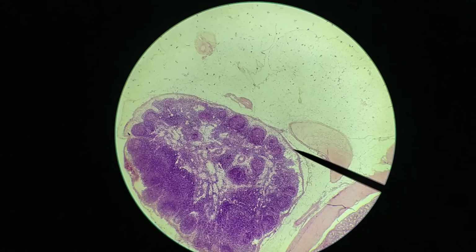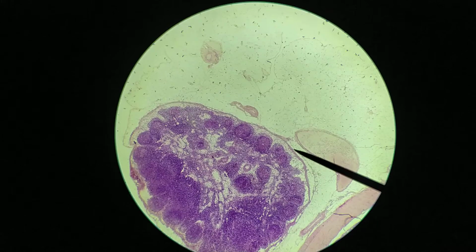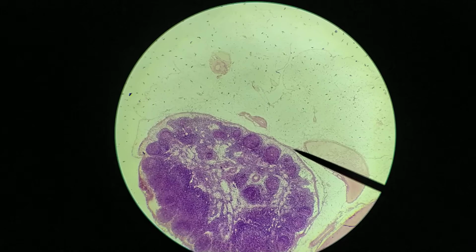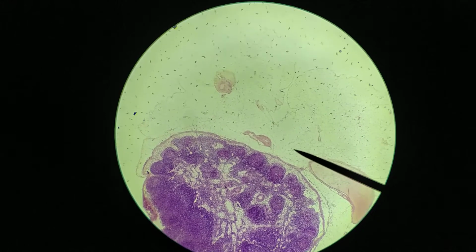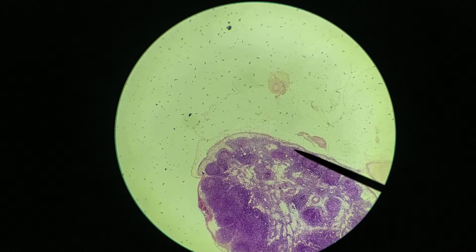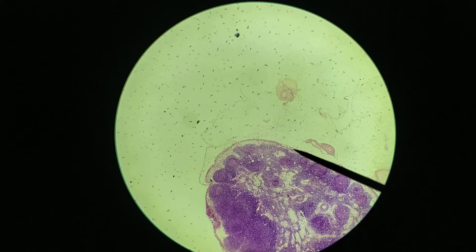Okay. Now the capsule of a lymph node is often described as being discontinuous. Now, that doesn't mean that I actually see whole gaps in this, but what it means is that there are many lymphatic vessels that pass through this capsule, and so some of these holes that you're seeing here, for example, are likely to be lymphatic vessels, okay? So those are penetrating through.